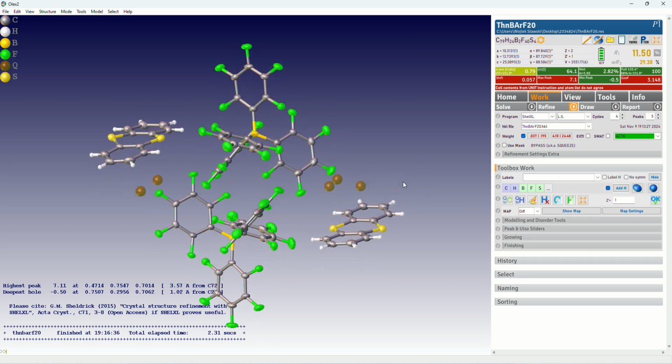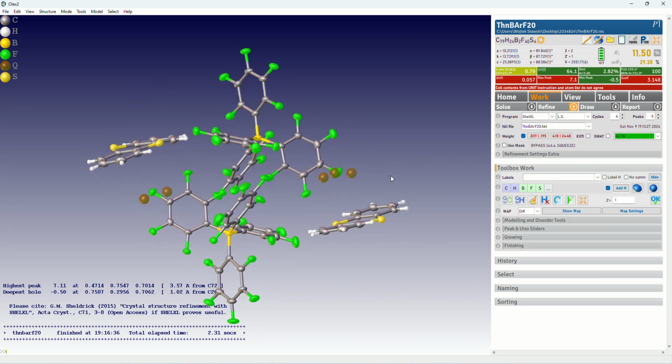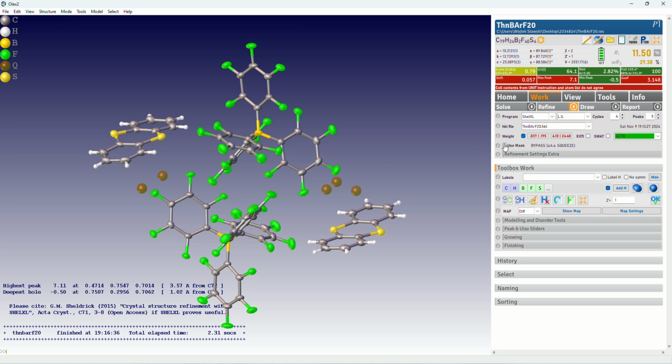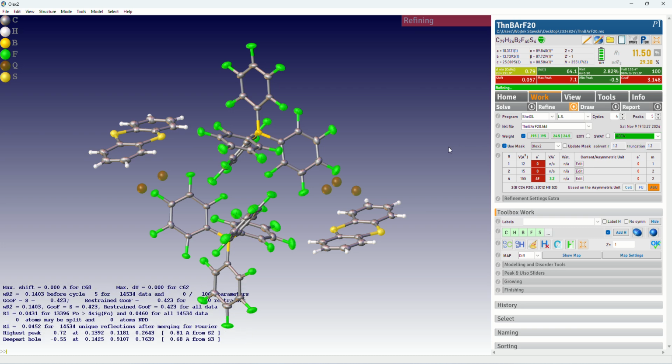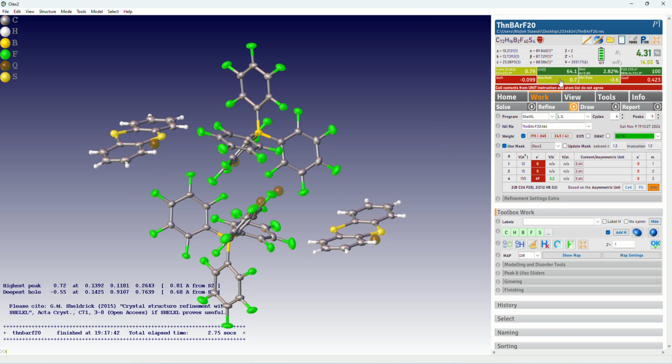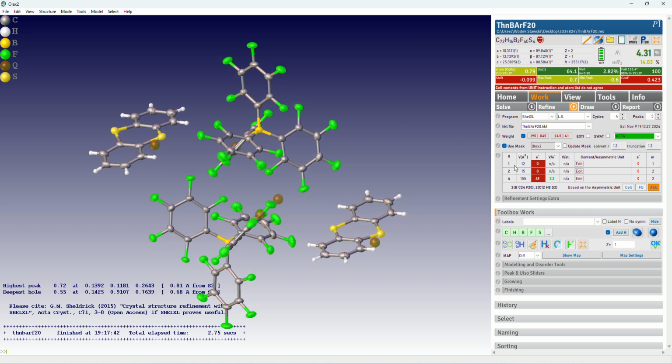So okay, we have a model which doesn't contain any solvent. We can now use mask, and we refine. You can see that parameters already got better. We don't have this terrible maximum of electron density, and we have a table. It says that we have 3 voids, 2 very, very tiny ones with 0 electrons inside, and 1 void that contains 49 electrons. And 49 electrons is very close to one toluene molecule. One fully occupied toluene molecule is 50 electrons. So you can see that in this void, there is basically the toluene molecule that we managed to model previously.